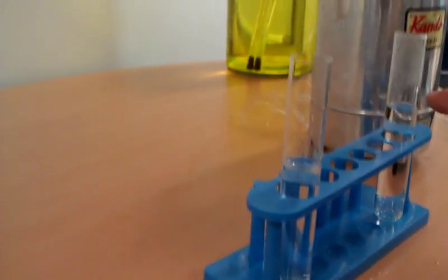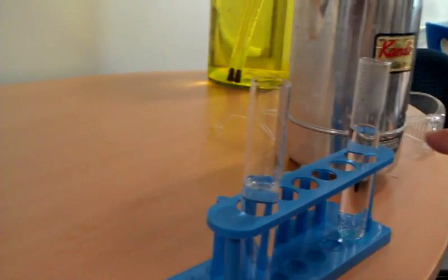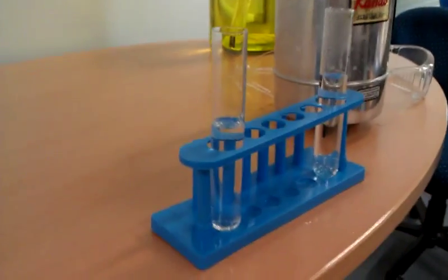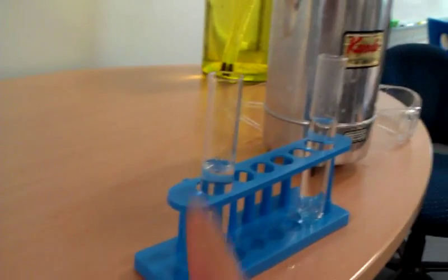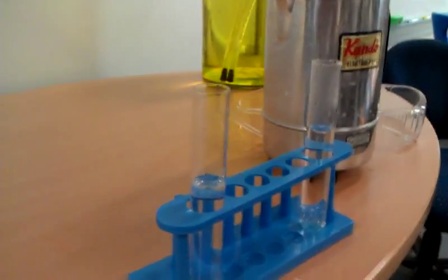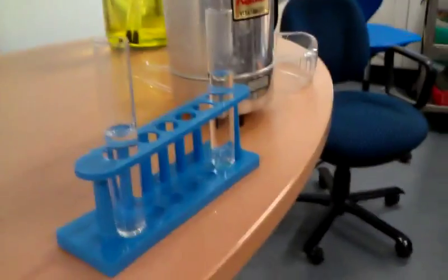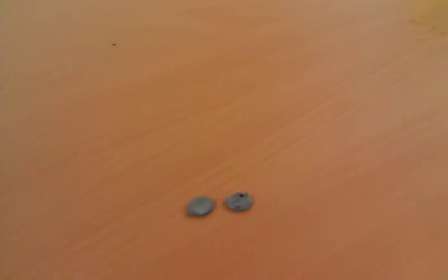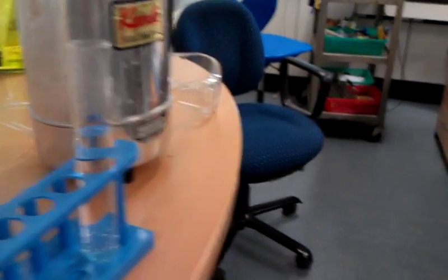We've got hot acid here and cooler room temperature acid solution here. Both HCl, both the same concentration. I have two small pieces of zinc that are about the same size, and I'm going to drop one in each.